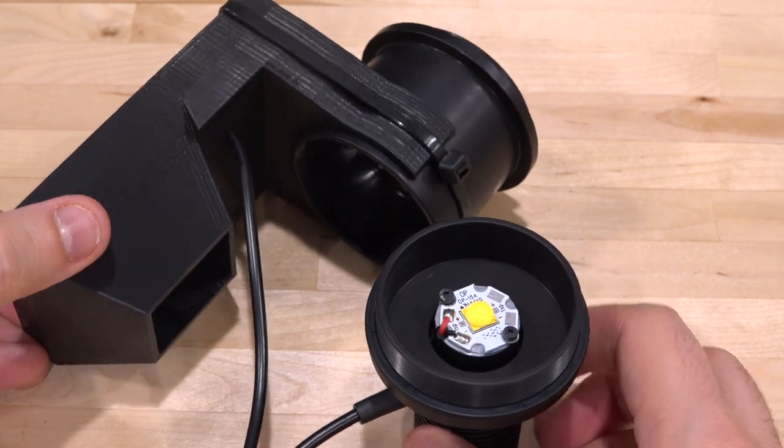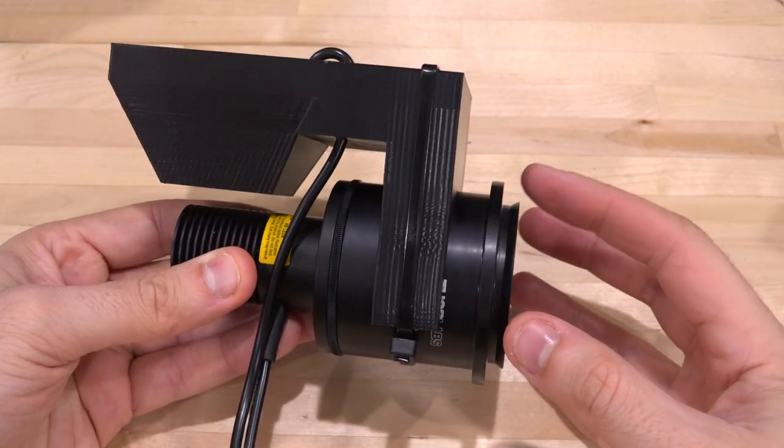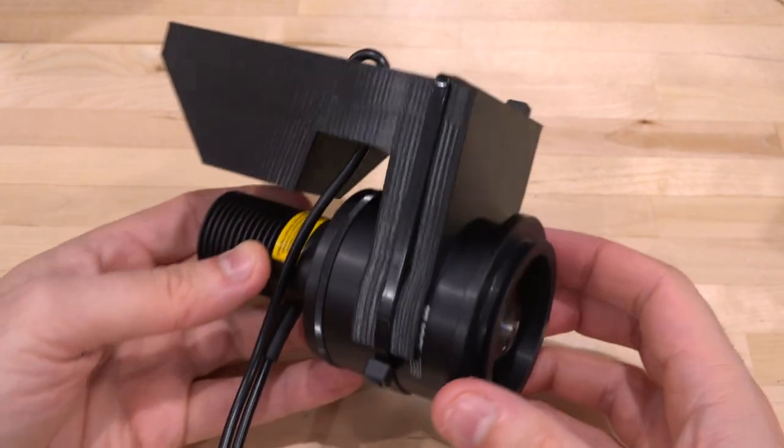So let me reassemble this so you can take a look at what it looks like. And here's what it looks like when it's all closed up. There it is. It attaches to the microscope from this side. And if you look carefully, you can see that it brings the LED light source exactly into focus there.